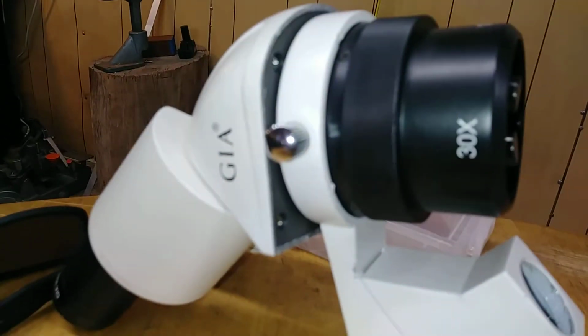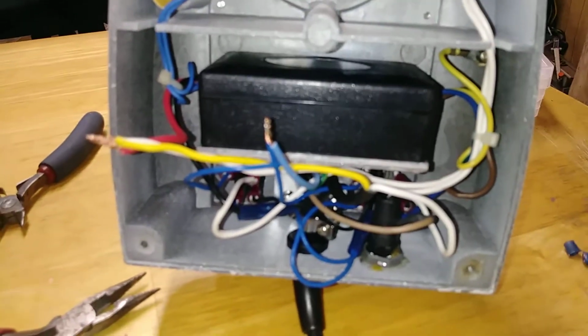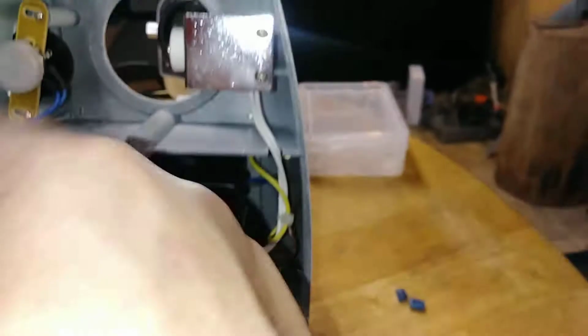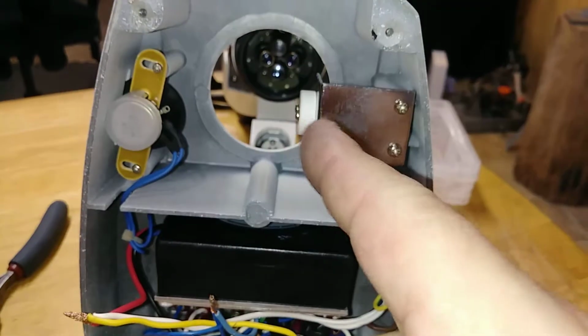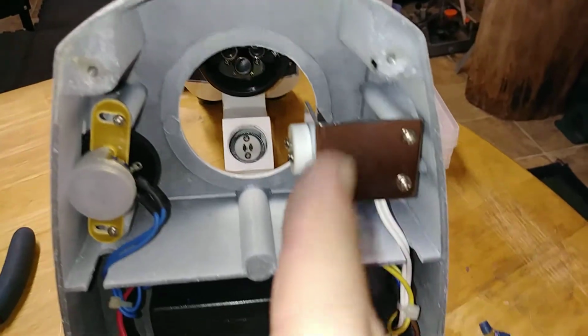I'm working on a GIA, Gemological Institute of America, registered trademark, GIA scope here. This is mainly the insides. There's more to the box, but we'll go over the basics. Basically, the wiring is what it is. There's a lead here for basically the focus.